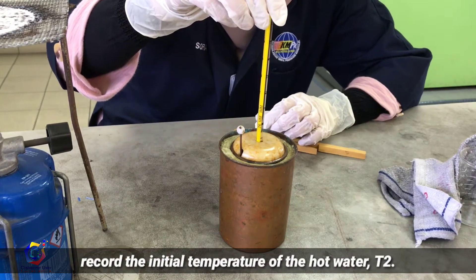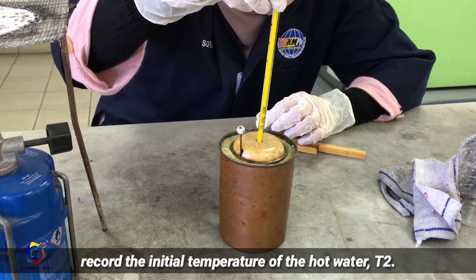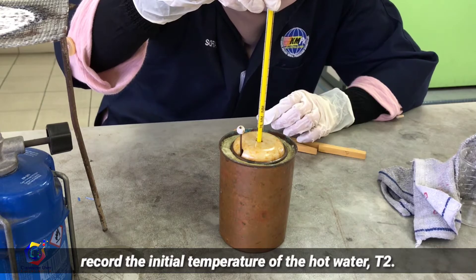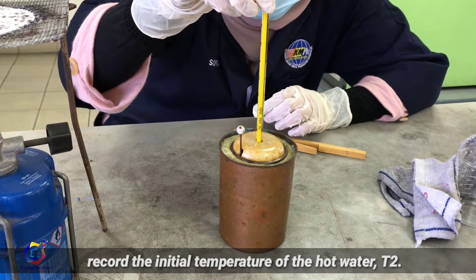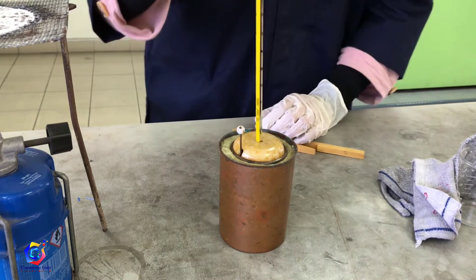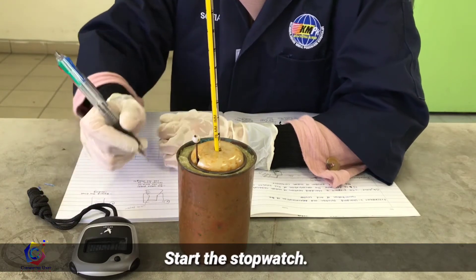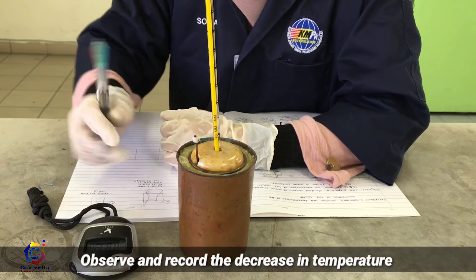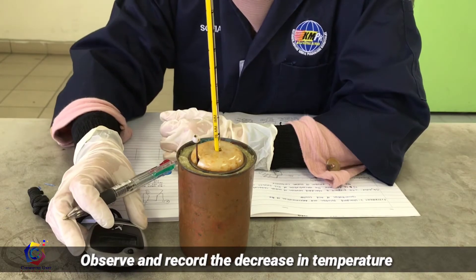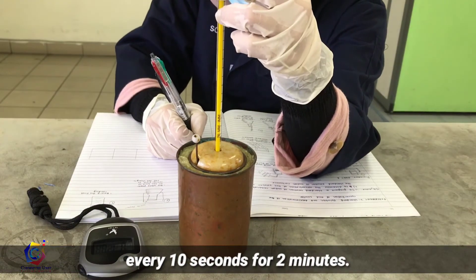At this point, you might need your friend's help to start the stopwatch. Next, observe and record the decrease in temperature every 10 seconds for 2 minutes. Record the temperature that remains constant — that is T3.